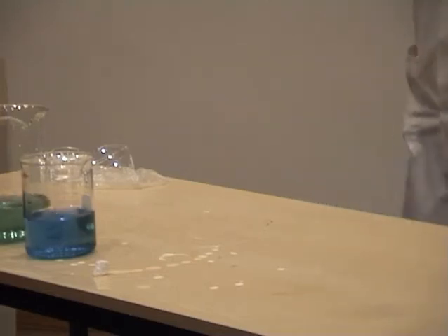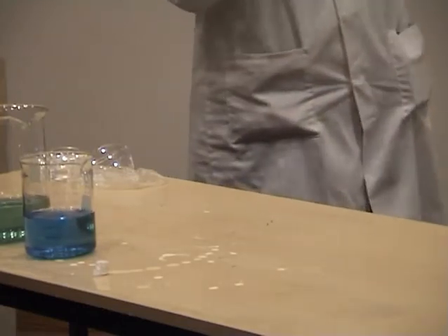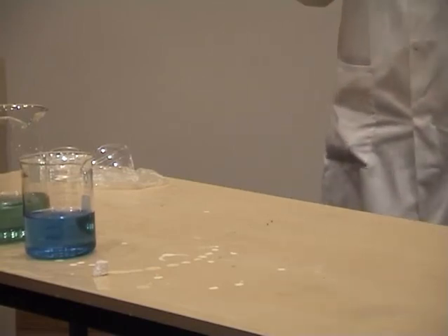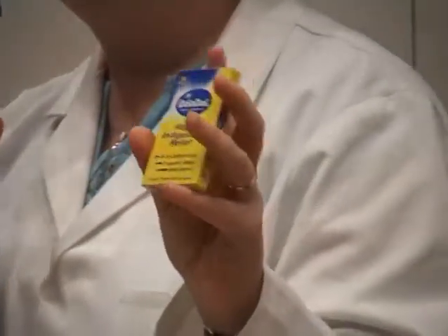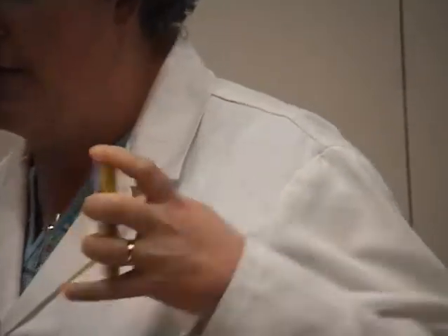Now, this lecture is supposed to be about science in everyday life. So I want to investigate what this product, can you see it? Isodol. It's an antacid. And we want to see what way that will behave if I put it into an acid solution. And Daniel is working away on getting an acid solution ready for us. So while he's working, I'm just going to get something organised.